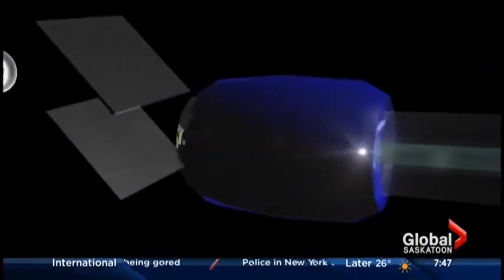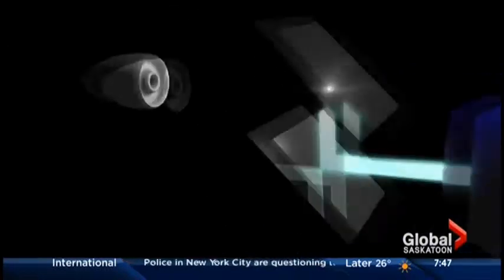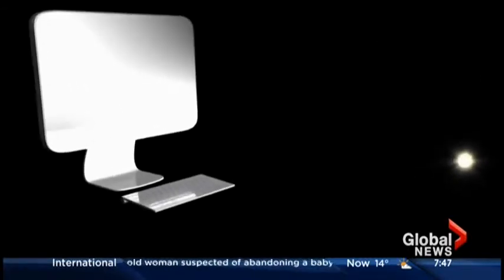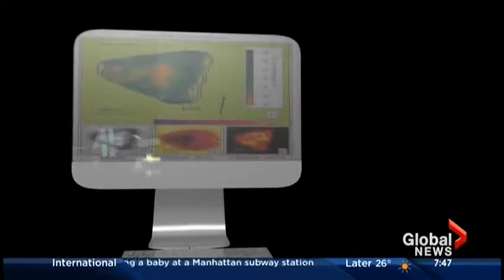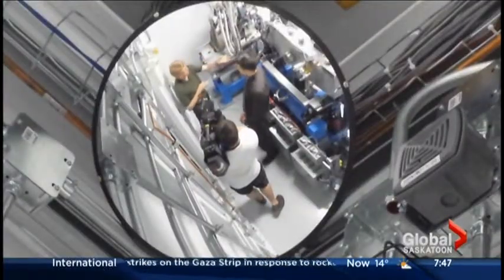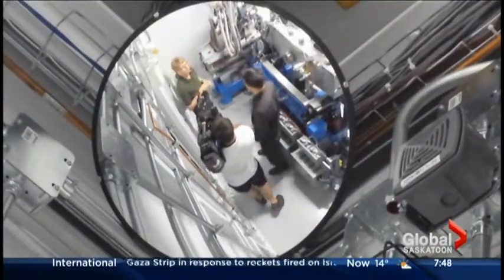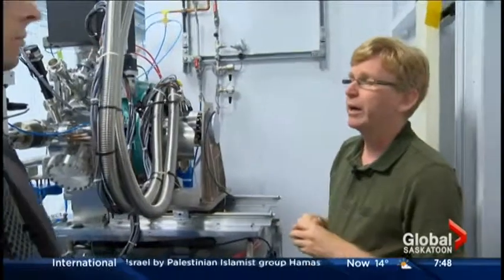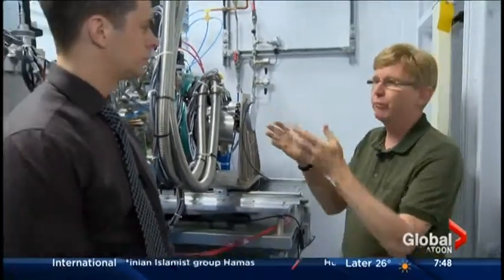And so these beamlines — you have a dozen of them. Are they all the exact same? Well, each beamline is unique. I like to describe a beamline as like a Formula One race car — it's not something you would buy from a Ford dealership. It's designed by the experts here at the Canadian Light Source, and we're trying to push the limits of technology each time. So each of these components, we design, we order, and we buy from the best manufacturers in the world. This monochromator, for example, comes from California. This mirror tank is built by a company in Burlington, Ontario that specializes in those things. And inside the mirror, it's really difficult technology — the mirrors may come from Germany or Japan.